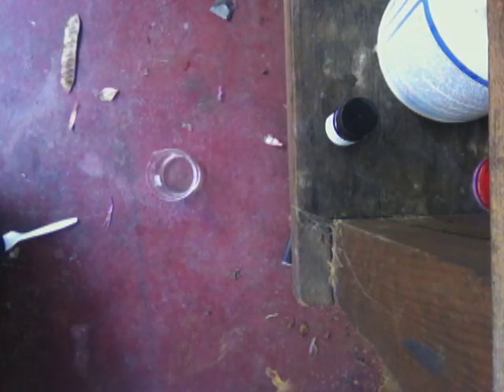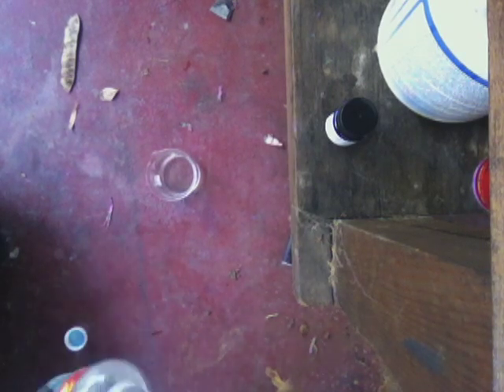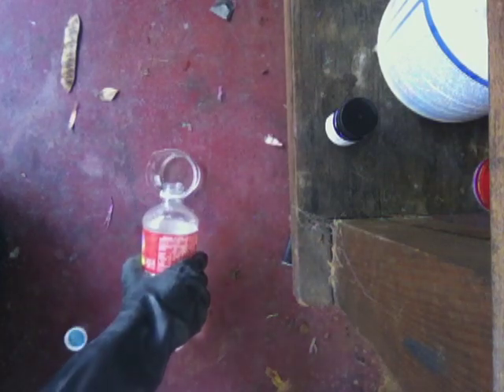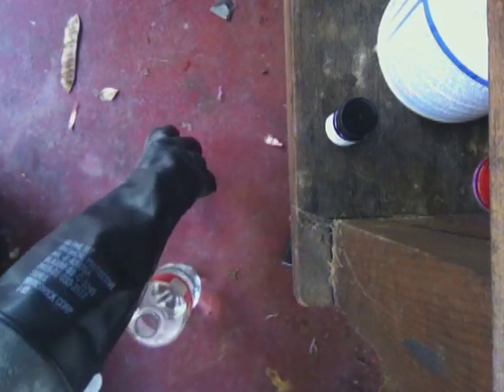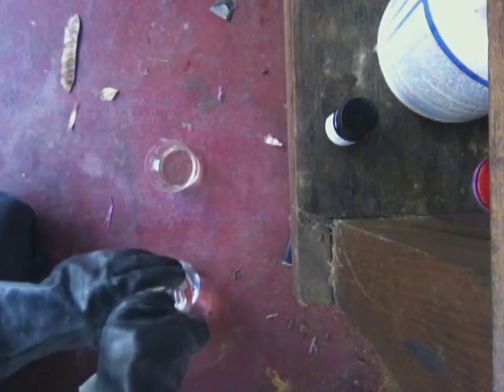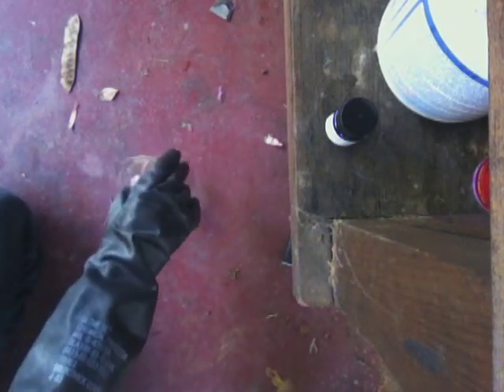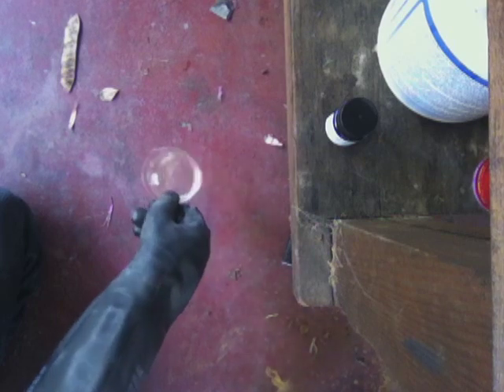Now we're going to add the strong mineral acid. The mineral acid I'm using today is hydrochloric acid. You can use nitric acid, which would precipitate the iodine immediately, but I think it would also nitrate the iodine — actually no, it wouldn't nitrate it because you don't have sulfuric acid, but it should precipitate it. We're going to add the strong mineral acid to this — added about 10 mils. I had about 5 and a half milliliters of water, so I added about 10 milliliters of hydrochloric acid.